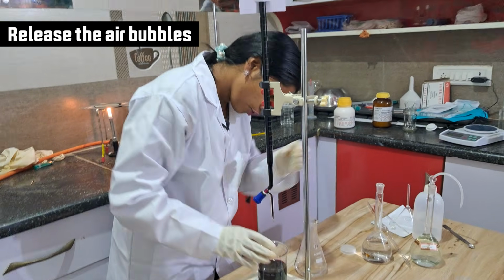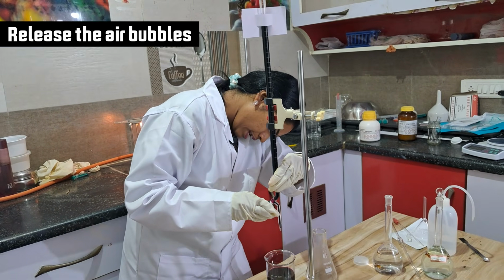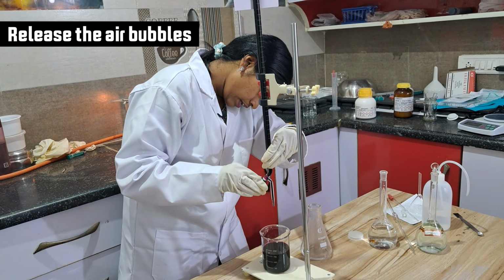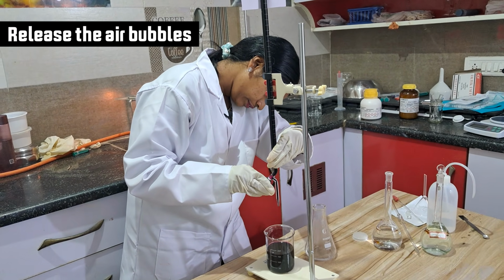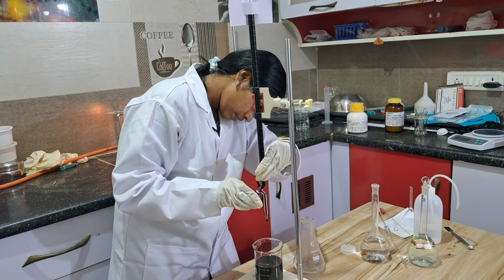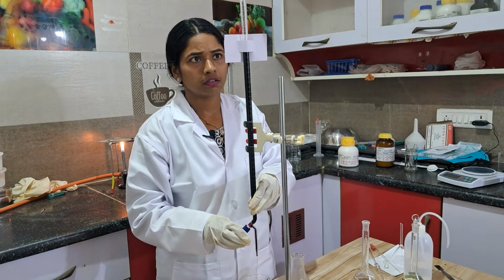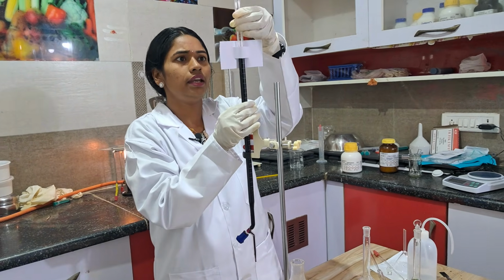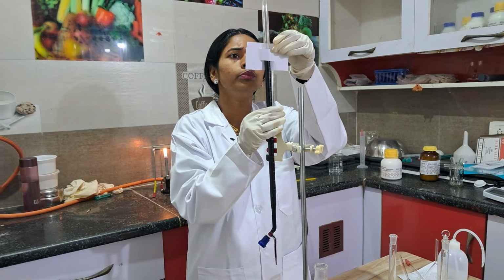Let me see if any drop or air bubble is there, and if so I will release it. One drop was a little down in the reading. Come, I'll show you.